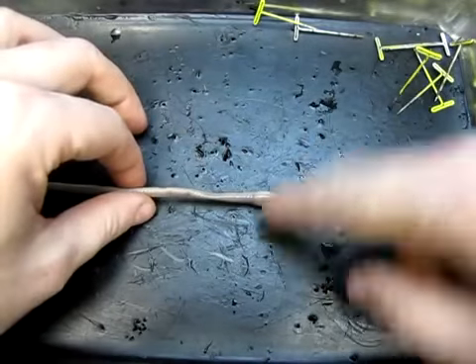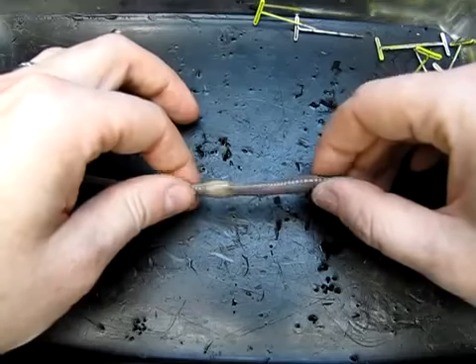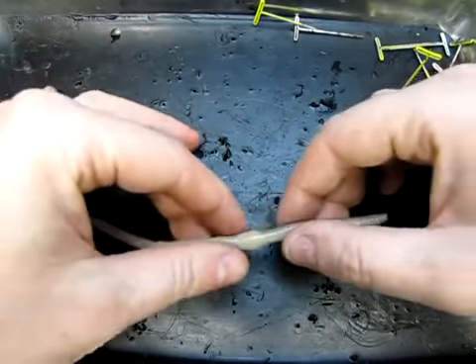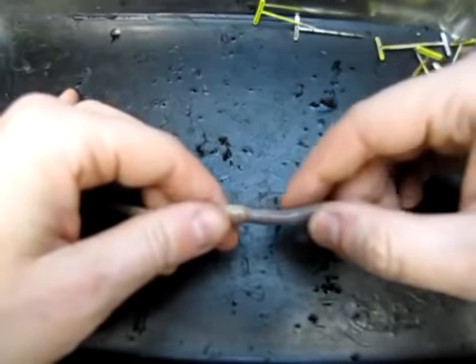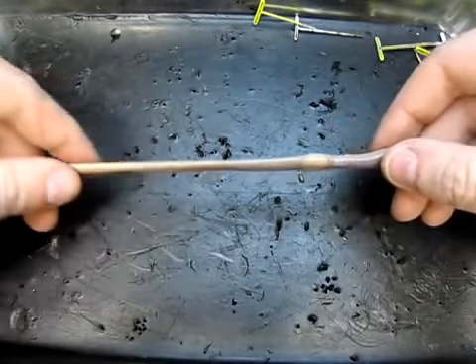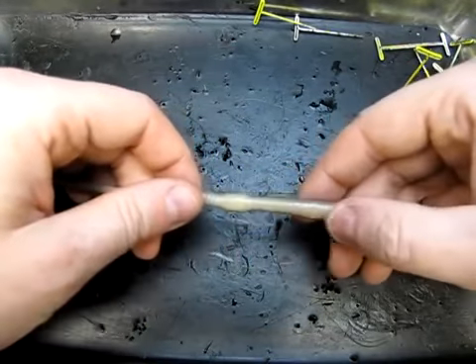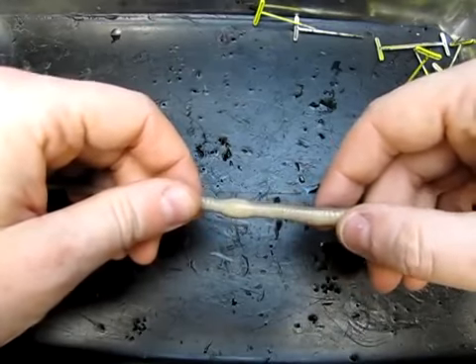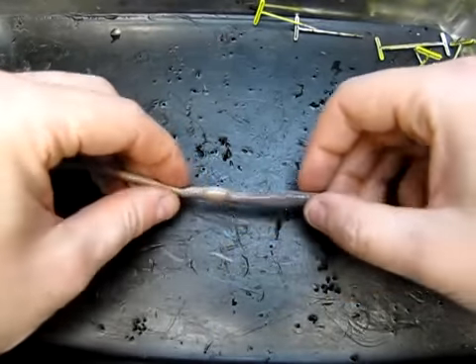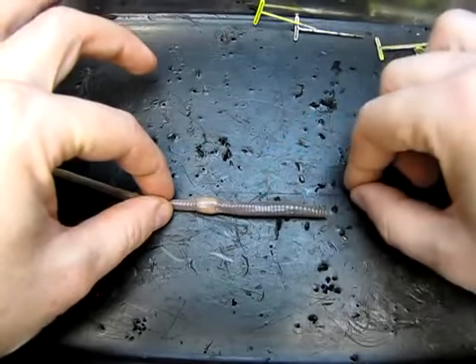So that's the clitellum. Some other things that you may notice, you'll see there's a bit of a color change front to back. There's also a texture change as well. Now if I run my finger up and down this surface of the animal here, it feels a little bit rough. There are setae, or hairs essentially, sticking out of the surface, the ventral surface predominantly, of the skin of this animal. So those setae are used to help the animal grasp the soil as it creeps forward. Okay, so there's setae on here.